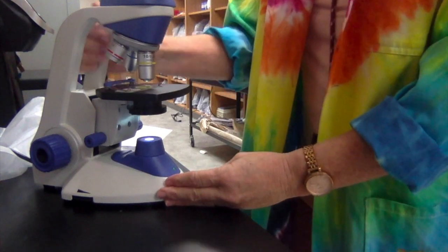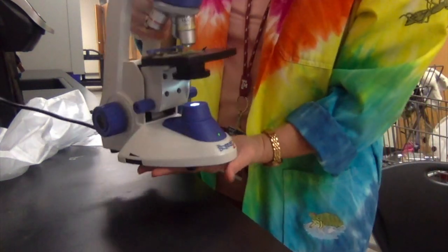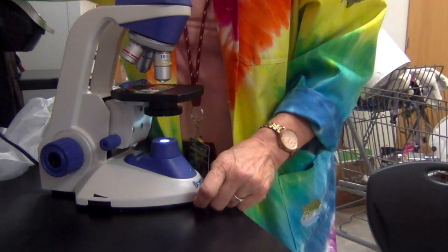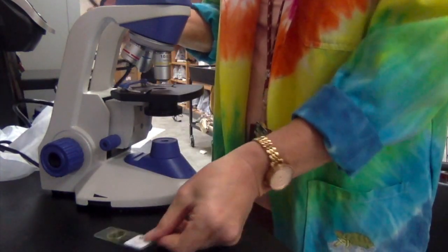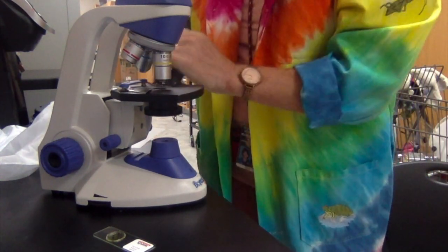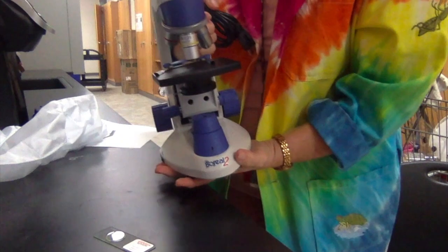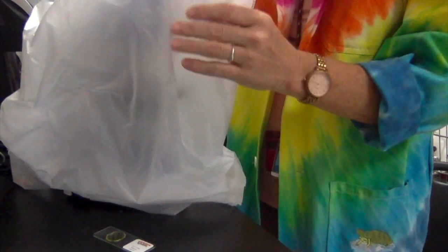Two other parts of this microscope are this carrying arm, the handle, and the base. So whenever we're moving or transporting it from the storage closet, you unplug it, and then you want to wrap up your cord. Wrap your cord up, wrap the Velcro strap around it, and tighten it together. Then you would pick it up by the handle and the base and carry it back to the storage closet. Put your cover on it. This is the dust cover, and that would keep it protected.